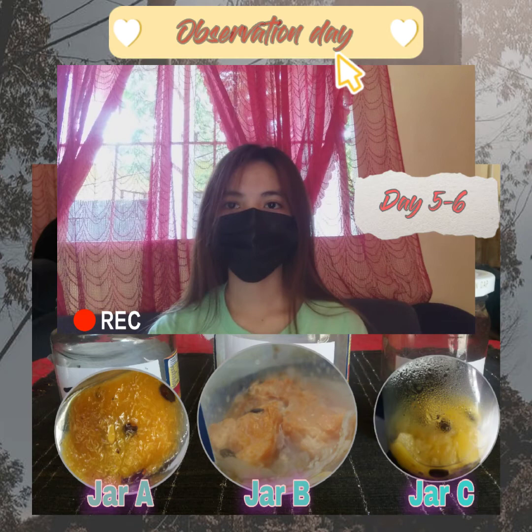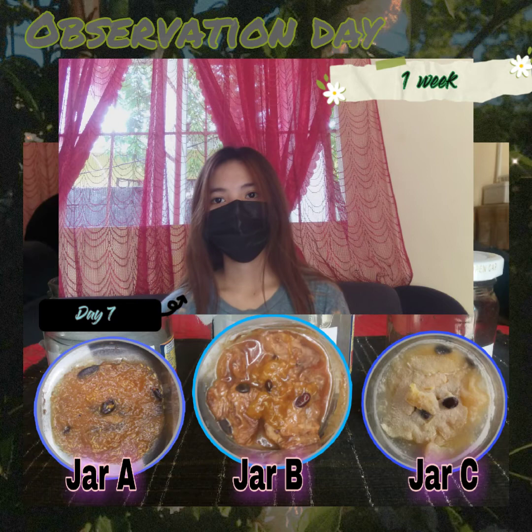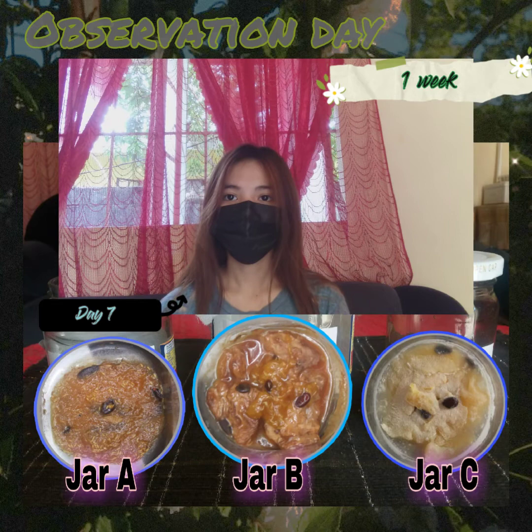Observation Day 7, or Week 1: You can see maggots in jar A and also in jar B, but jar A has more maggots than jar B. Therefore, insects in jar B cannot enter but can lay eggs. Furthermore, both are starting to dry as you can see the color change to orange going to brown. Finally, fungi in jar C is now present, and all jars are still disgusting.